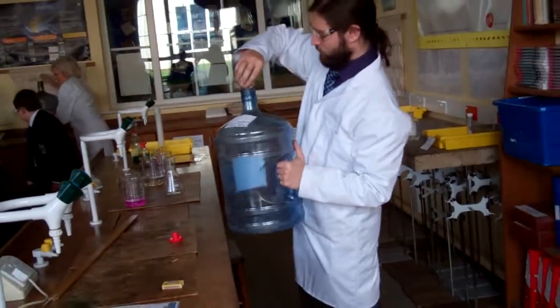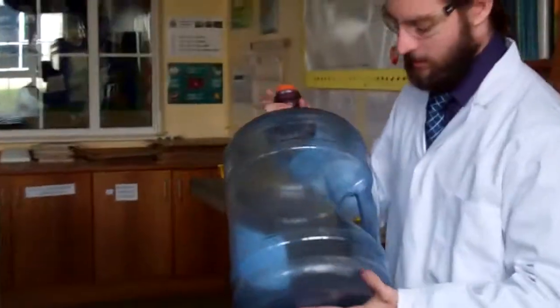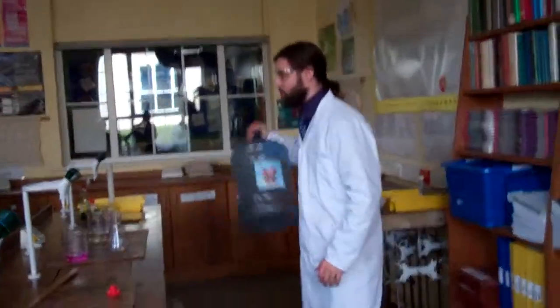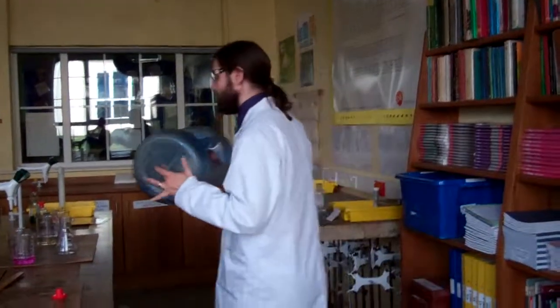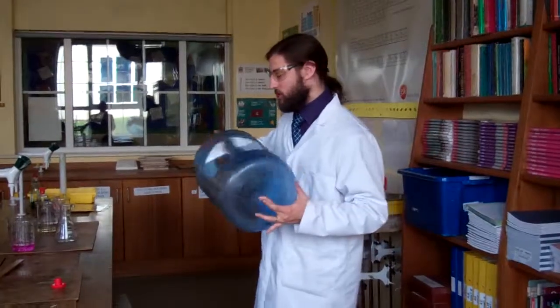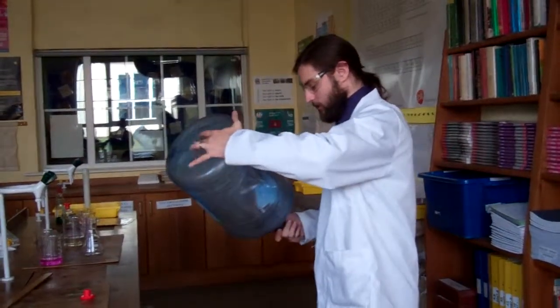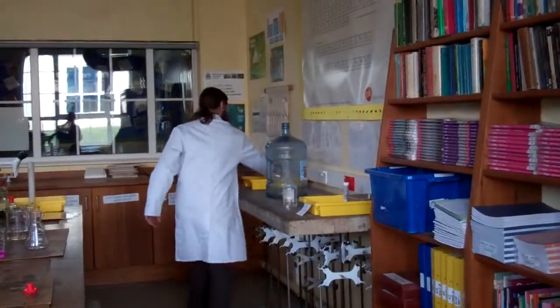Let's see if we can get our whoosh bottle again one last time. Let's put our fuel in. The alcohol we're using is really flammable. When it burns it produces gases — it produces carbon dioxide. As that carbon dioxide leaves the bottle, that's where we get our whoosh sound from. The heat also expands the gas that's already in here, and that also whooshes out. We get that nice sound and the nice flame colours inside. So let's give this time to evaporate and see if this can go as well. That's looking good — it's beginning to evaporate a bit.